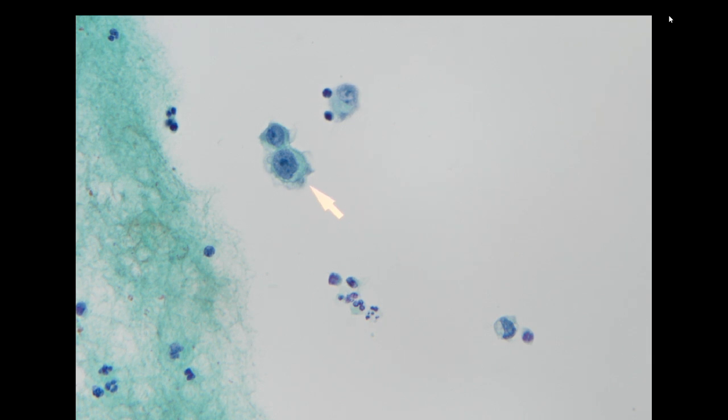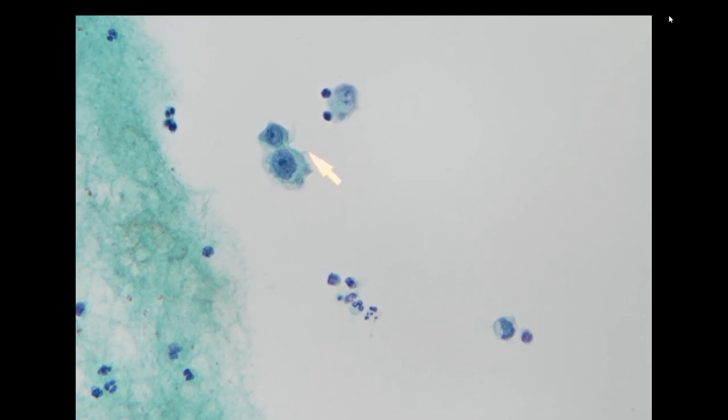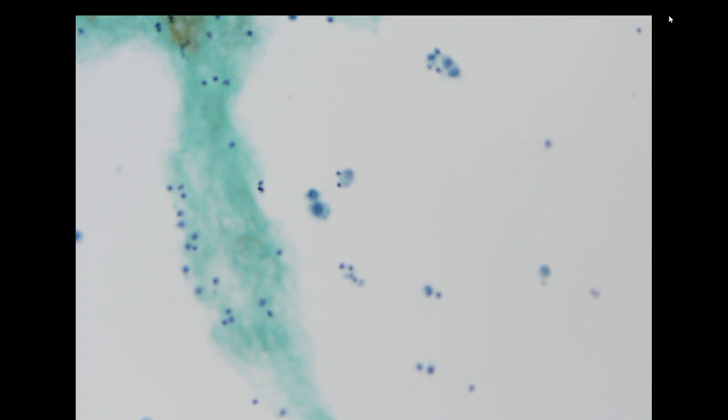between the mesothelial cell and the poorly differentiated adenocarcinoma. So these double layer cell contour is not specific for mesothelial cell. So these needs to be addressed. The other thing is that if you do see the cell with prominent eccentric arrangement of the nucleus, it is more likely to be a poorly differentiated adenocarcinoma than a reactive mesothelial cells.